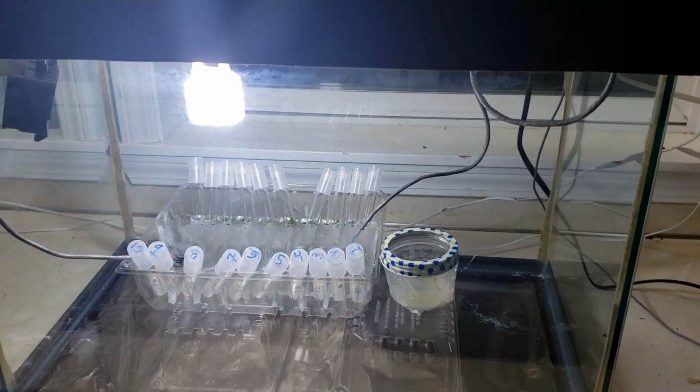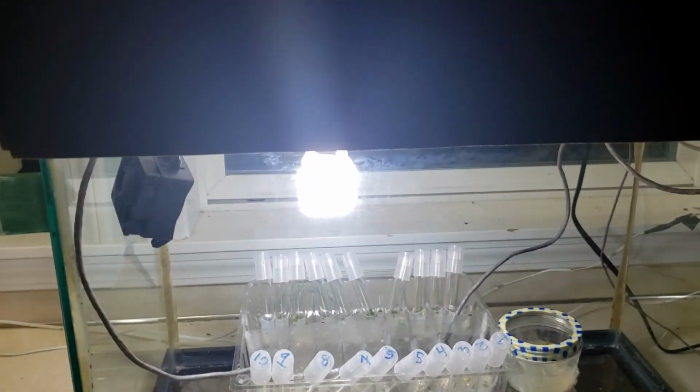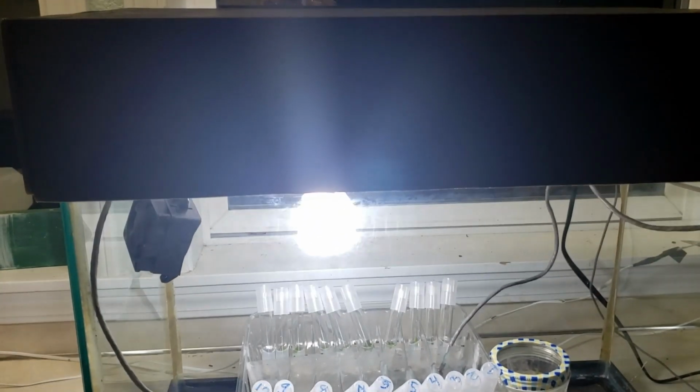Then up here, with this tiny, tiny LCD, and this is still a work in progress, but you can see temperature one is 25 degrees, temperature two, 26.5, and then I have humidity is 49%. Top right is just the time of day, so I'm shooting this at 9:48 in the evening. And then I still haven't adjusted the text down below. That is just going to tell me what state the whole control system is in. So if it's supposed to be heating or cooling or just holding the temperature. So now I'll crack the hood open and I'll show you all the specifics inside.